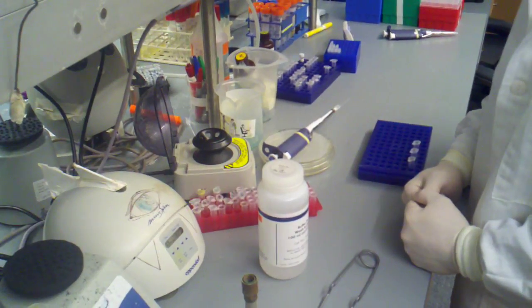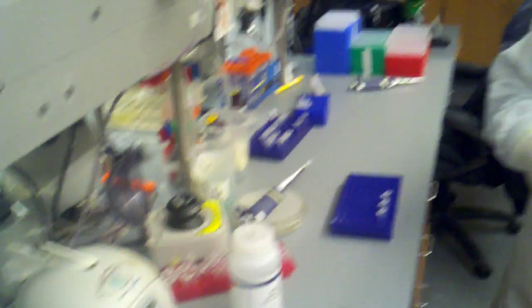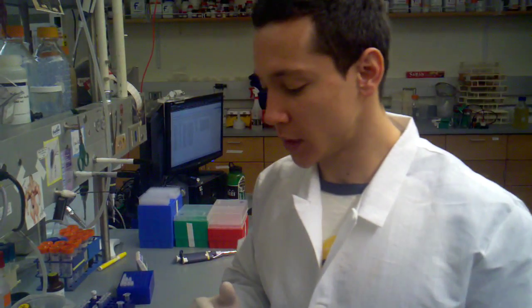Get a new tip and wait for that to spin down. So right now, the PE is hopefully getting rid of any contaminants. Maybe if there's any excess agarose that's left in there, hopefully it's flowing that through. And we're going to be left with a bunch of PCR DNA that is stuck to that resin bed. So, almost done.